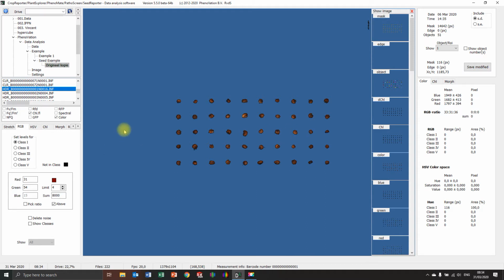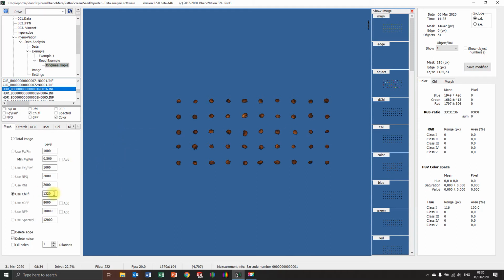Always remember, when you do this and you increase the mask again, or you change the mask again, so you put it on 1350, it will calculate everything back again. Also with it, oh, the noise is still gone. That's good. Normally it would do that. Maybe that's an update I wasn't aware of. Let me see. Oh yeah, great. So it will remember the eraser. That's really useful. But there it is back again.